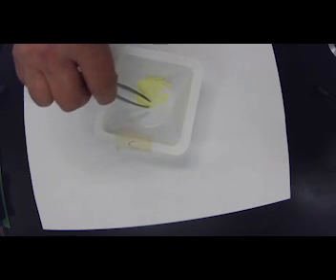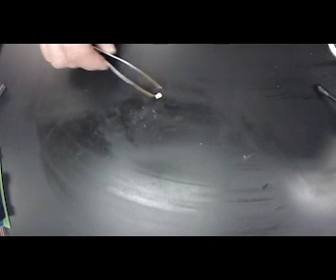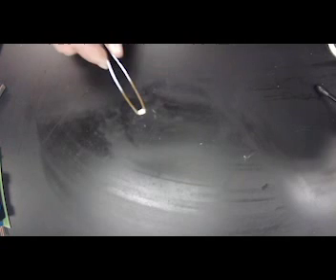So I'm just going to grab one piece of sulfur. You don't want to touch sulfur. There it is. It's really hard to see though, huh? Let me put it on the black and see. There you guys go. Now that's a little easier to see. So it's yellow. It's definitely not shiny. There is no luster. It's kind of dull. Looks a little dusty.